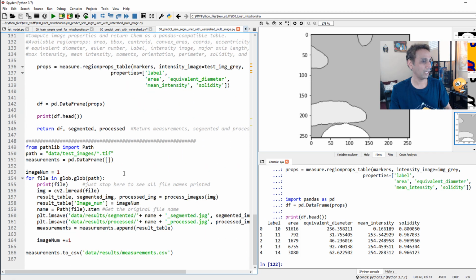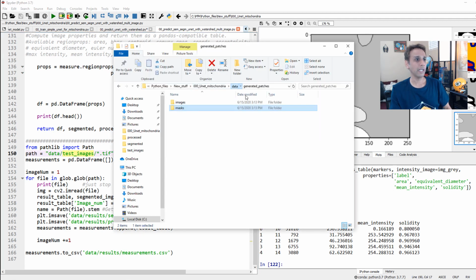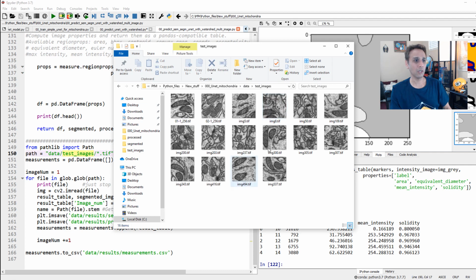And what do we have finally? Once you define everything in this function, it returns three things. It returns the actual data frame itself, which is our measurements, the segmented image, and the processed image, which is object separated. Now I just need to call this function. It's very easy, right? This is my path where all the images are, data, test images. These are all the images that I would like to segment.